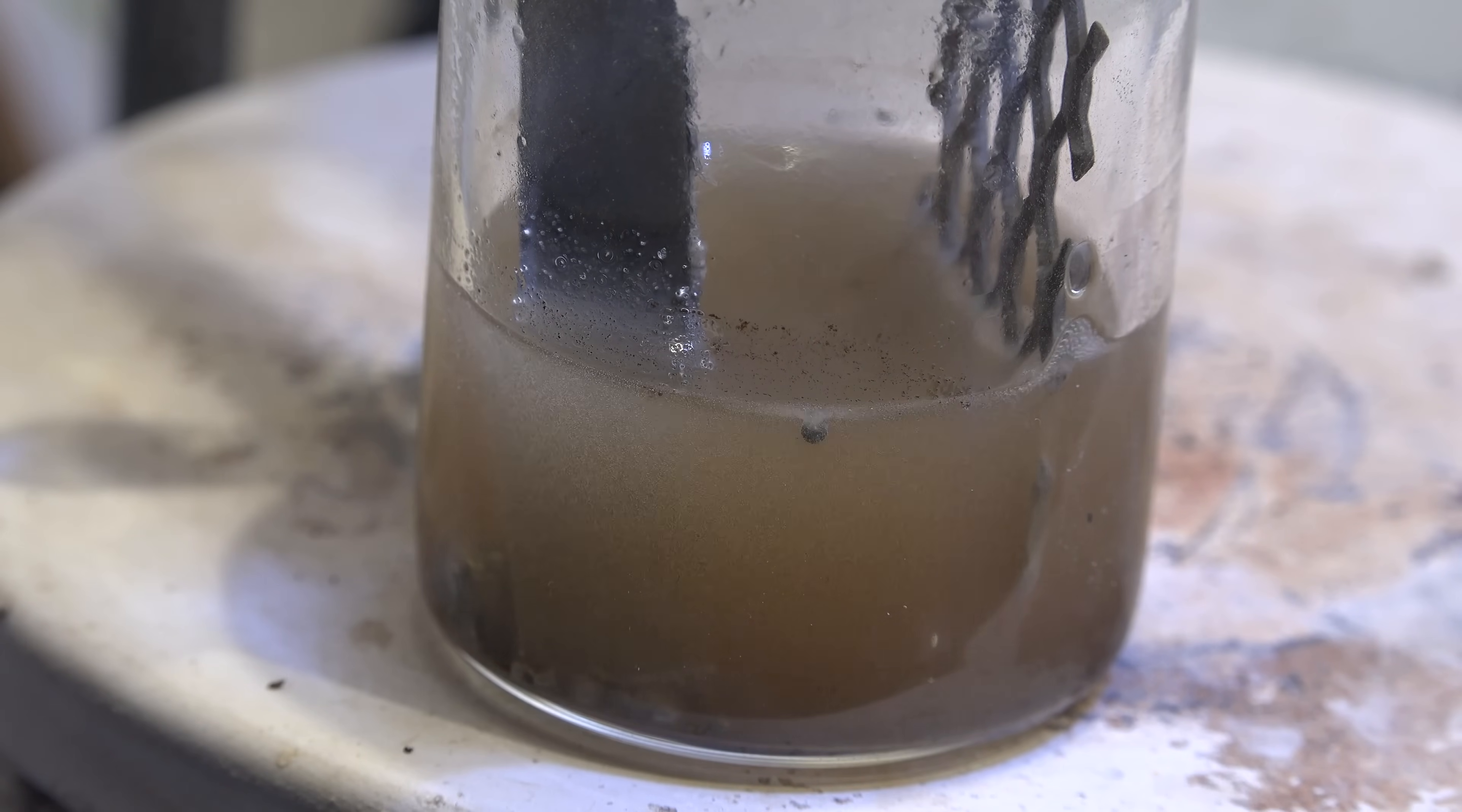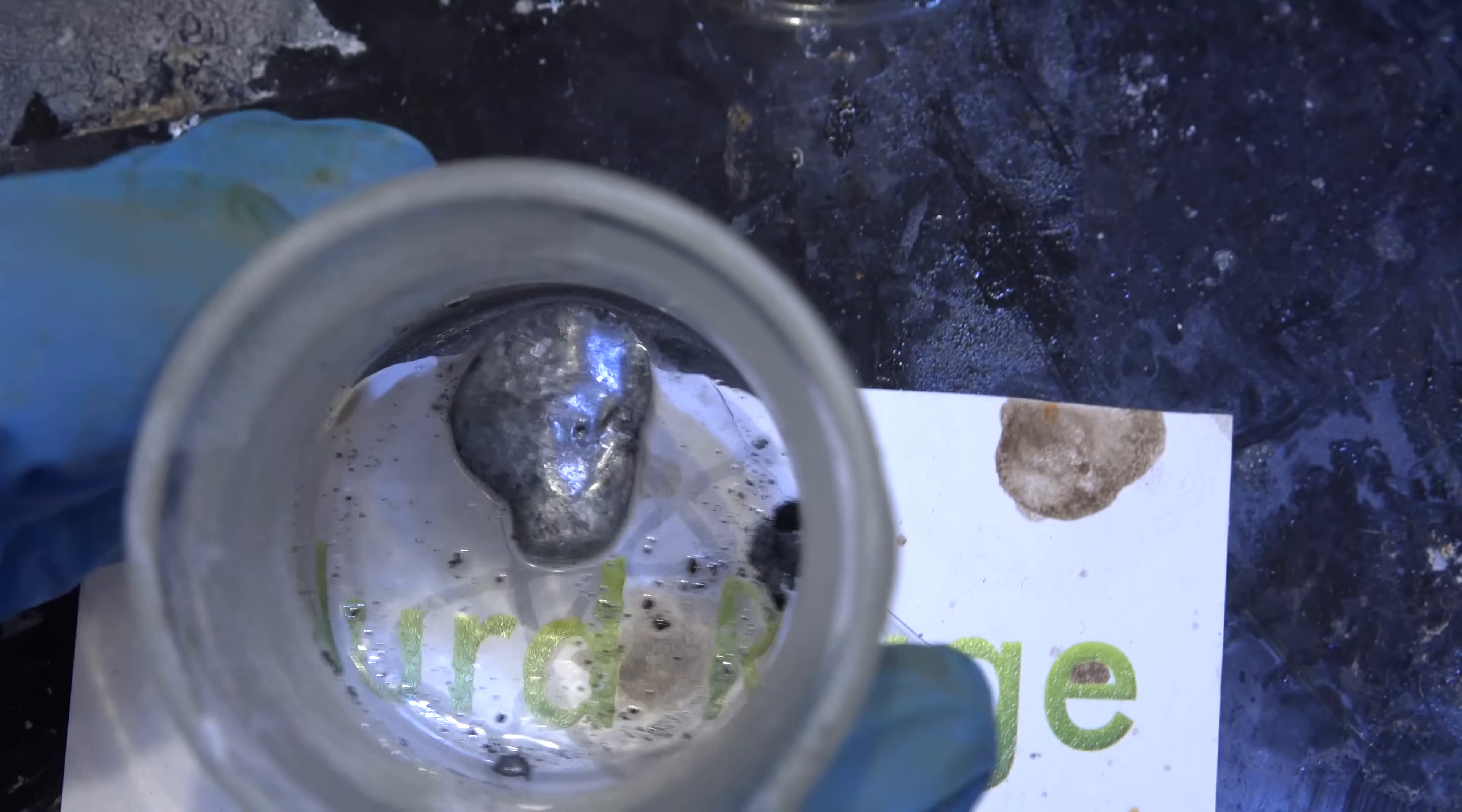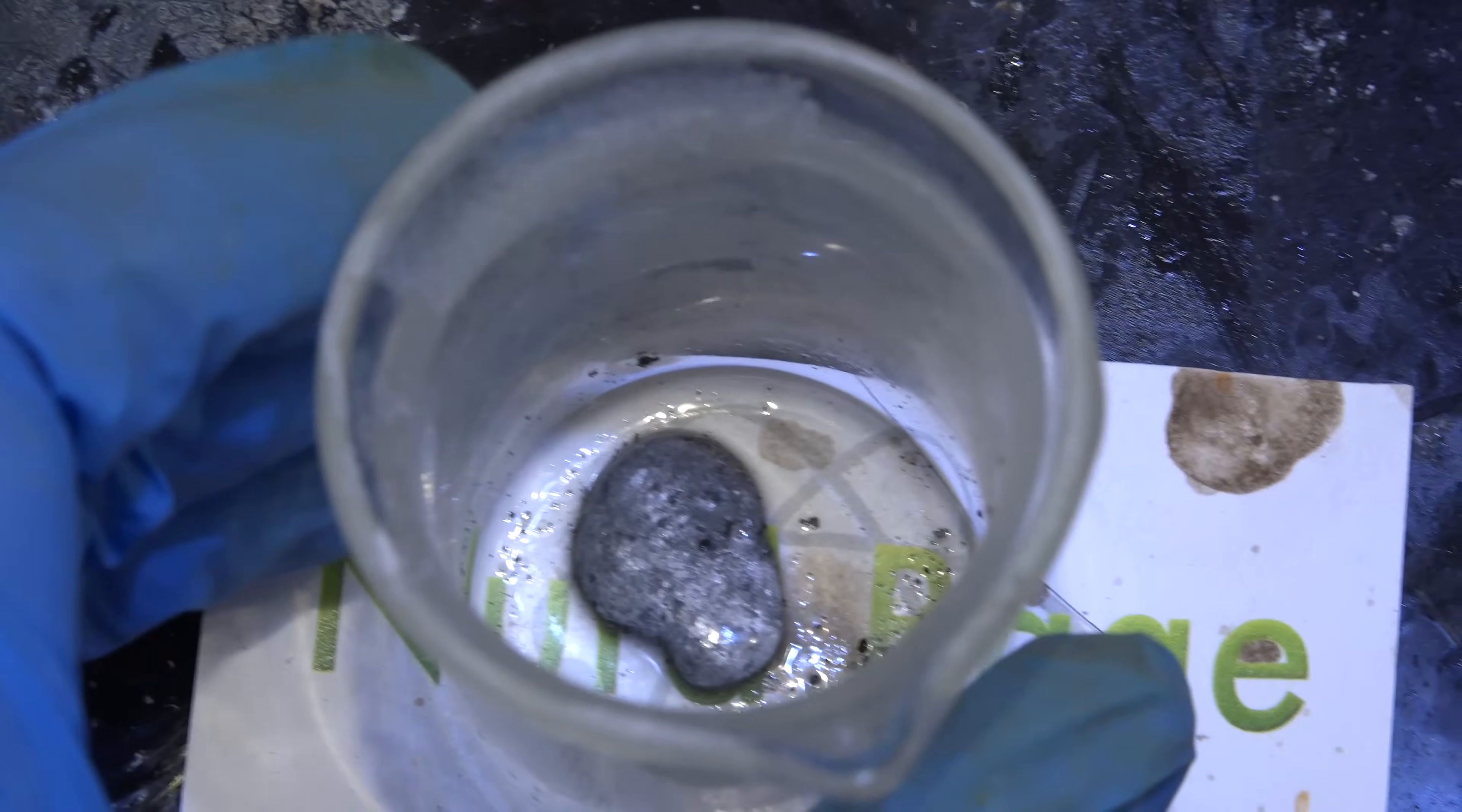Anyway, keep electrolyzing until no more gallium deposits out. And there we have it, gallium metal recovered by solvent extraction and electrolysis.